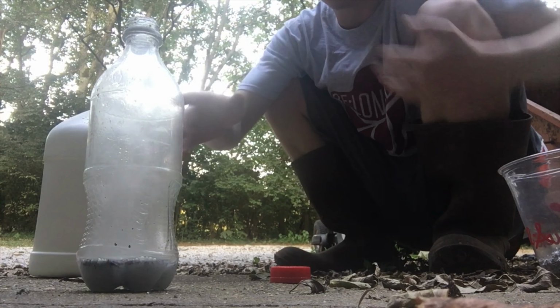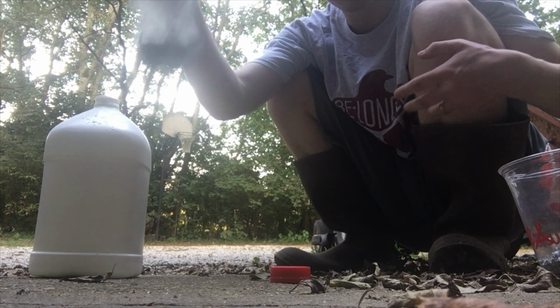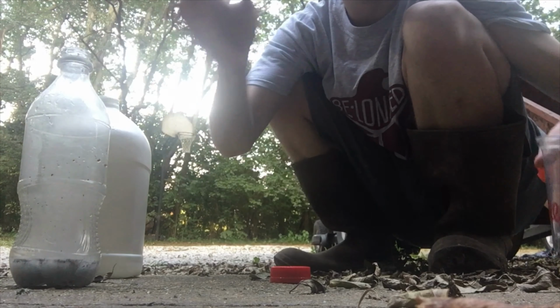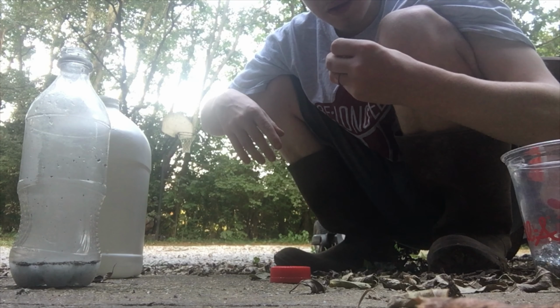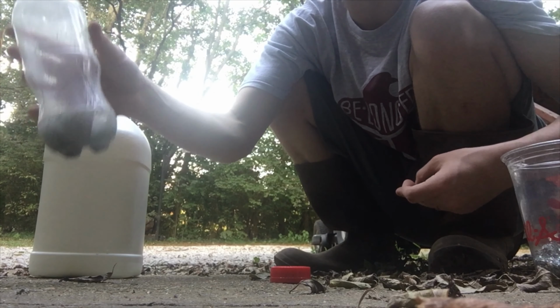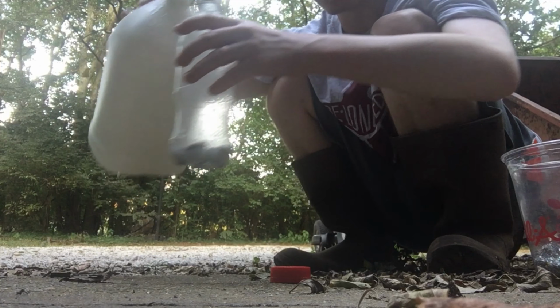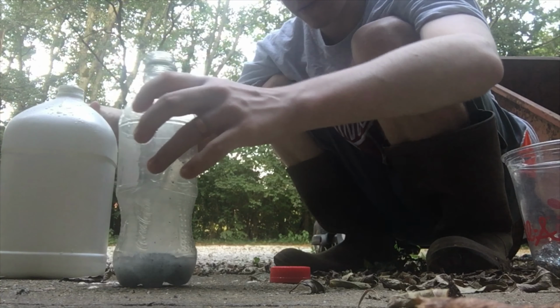One reason why it does go so quickly is because these are tiny little fragments of zinc. If you look here, see? Just tiny, minuscule little fragments of zinc. And so this creates a very good solution of zinc chloride, because we know that the zinc is almost completely fully reacted with the hydrochloric acid because of how small these shavings are.